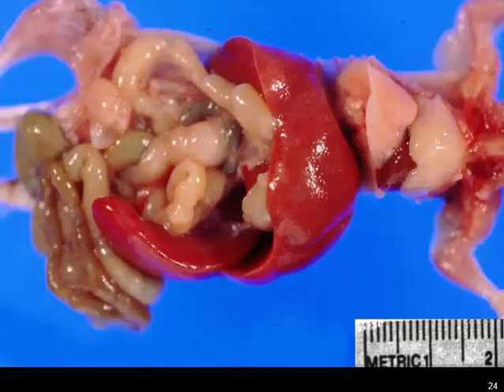Here's a nude mouse with a couple of very important concepts to know about lymphoma. The first is, whenever you see a large spleen and liver in a mouse or a rat, I want you to default to lymphoma. The causes of these changes are very rare other than lymphoma. We will talk about one, but there are tremendous numbers of pictures of mice and rats floating around out there with their abdomens open, with huge spleens and livers, and if you say lymphoma, you can never be totally wrong.